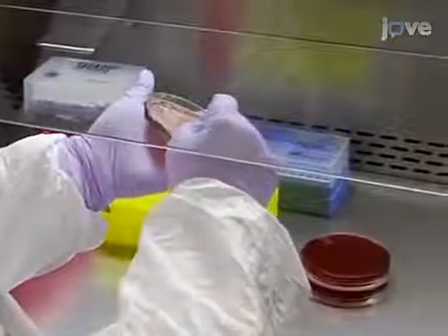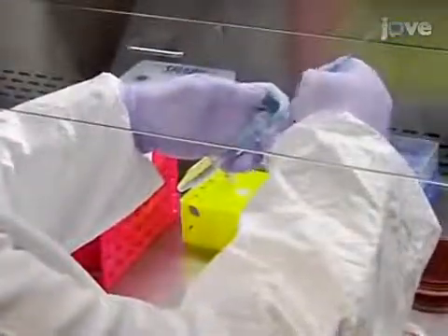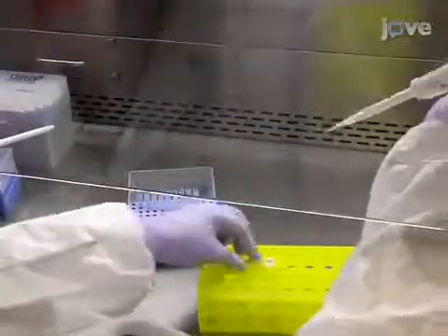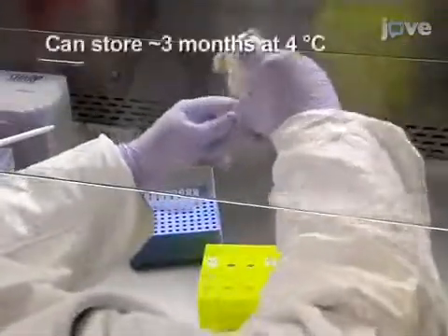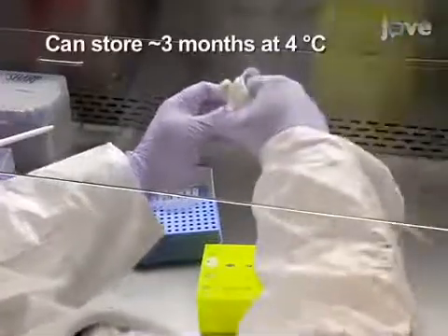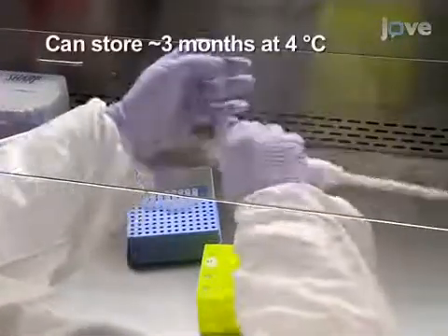After approximately 15 hours, use a bacteria loop to transfer the colonies into 5 millilitres of PBS. Then serially dilute the bacteria in more PBS to concentrations of 1 to 10 to the 4 through 1 to 10 to the 7.